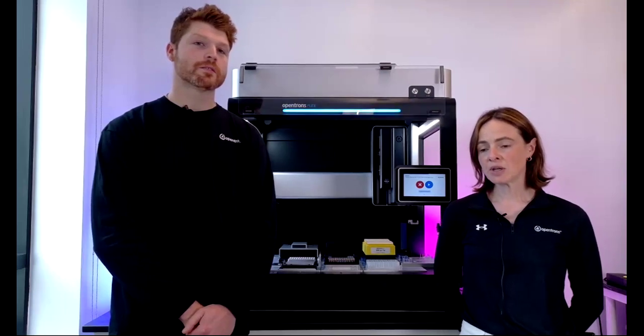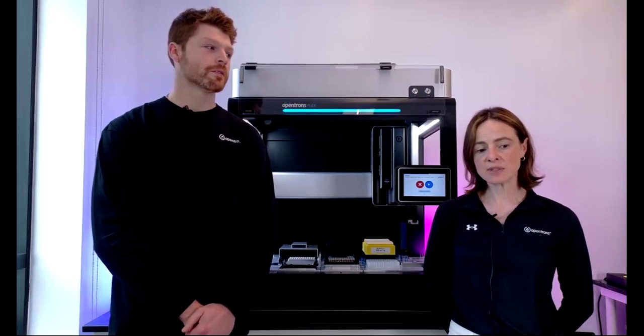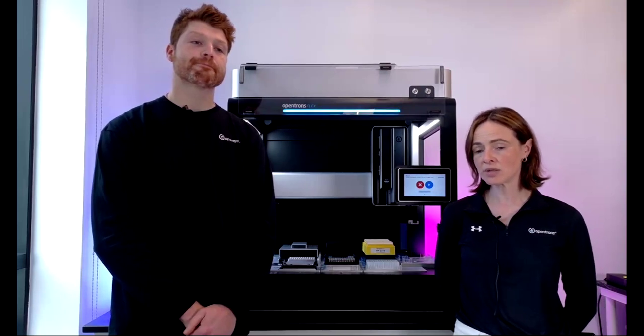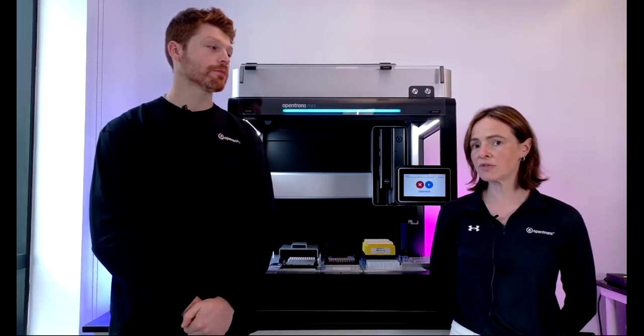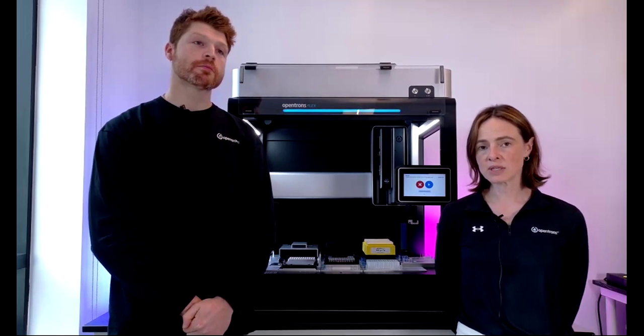Great. Jeff asks, is the Flex able to pipette stronger acids, e.g. formic, and organic solvents like isopropanol or chloroform? Would the solvent reservoirs for this need to be unique? We do have some limitations in terms of the solvents that we can pipette. If this person has put in their contact details, we have a list available online that covers the solvents that we can't touch. I know that some of those listed are not okay, but there is a full list available on the website, and if they've put their contact details in, we can send it to them afterwards.